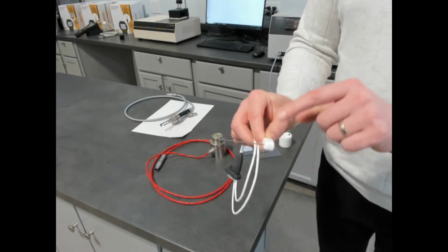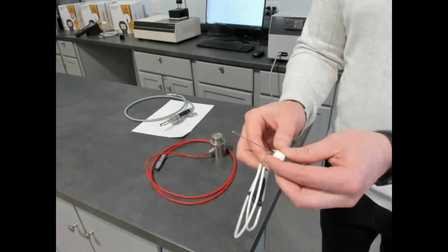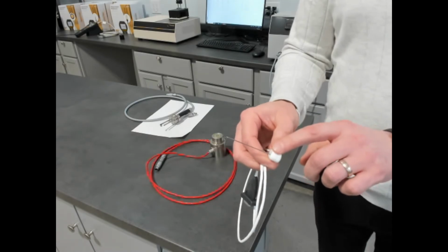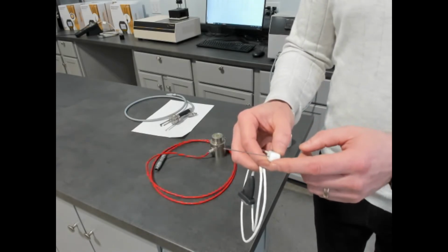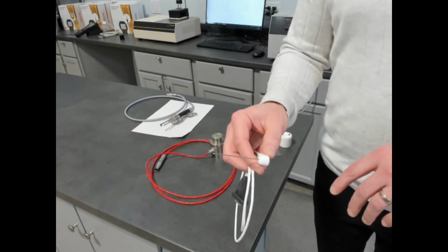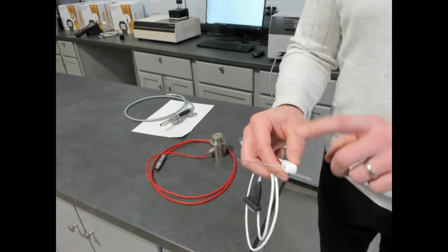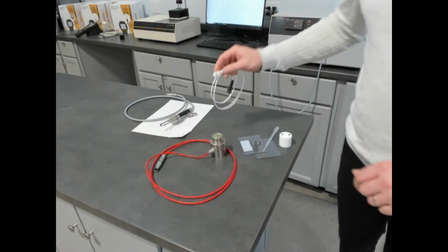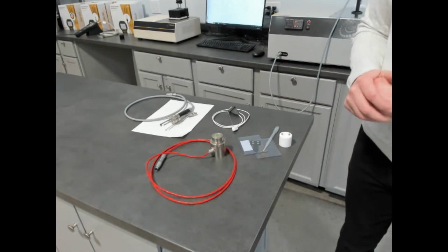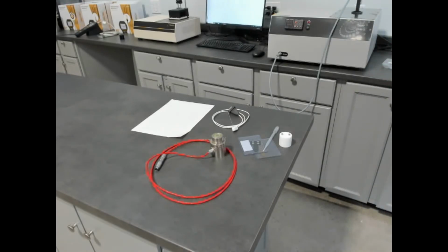Within that 1 minute, you're creating a large delta T that will give you effects of convection. There's no way to correct for that. So there's a lot of publications that show use of this needle for measuring fluids. And you'll see that as you get into water and lower viscosity in the water, the results are often skewed by convection. And that's a really important point. So if you're looking for accurate values of thermal conductivity of fluids, you have to consider these things. So getting back to our transient hot wire sensor.